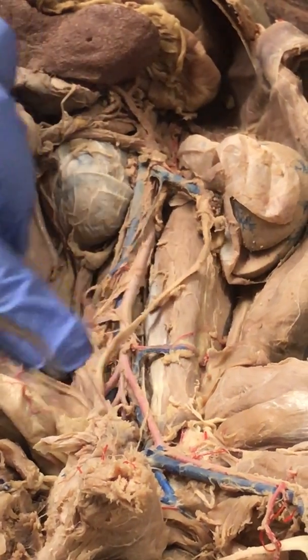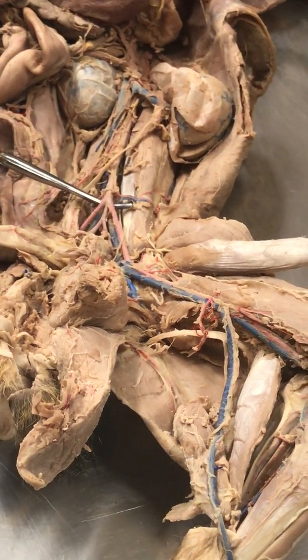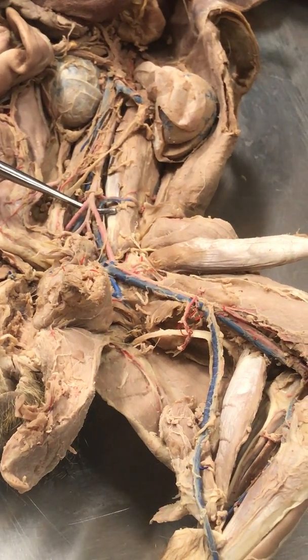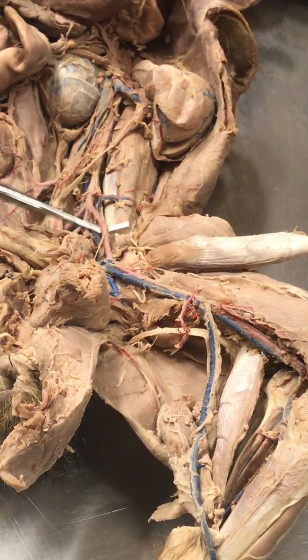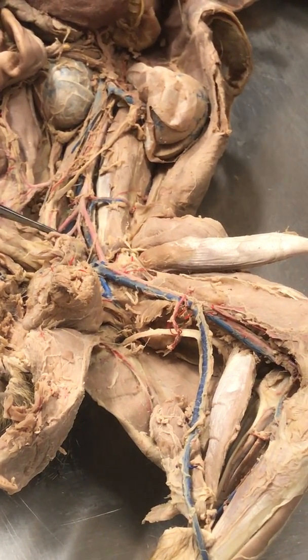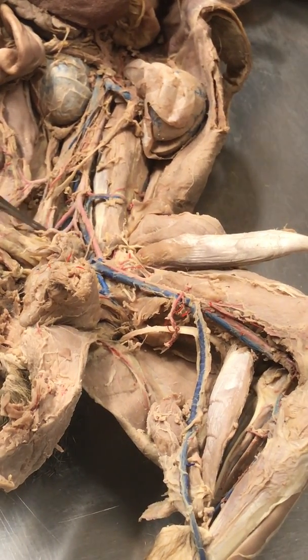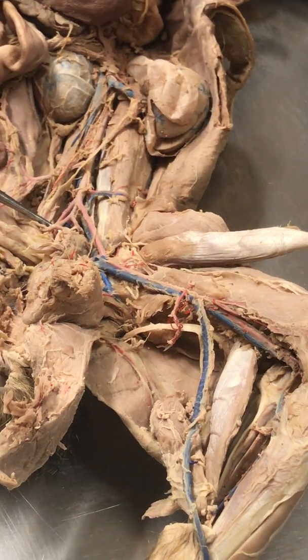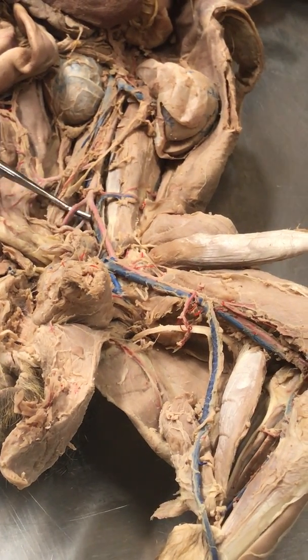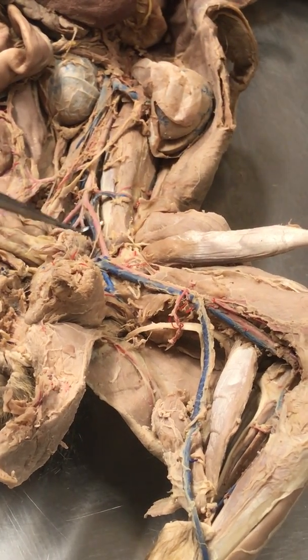Now, if we follow this, if we go downwards, you get to see that at some point the aorta will bifurcate. It'll stop, right? It'll split. Cats do not have a common iliac artery, which means that this vessel is not the left common iliac artery. This is the left external iliac artery. This little one is the left internal iliac artery, and this other little one, the right internal iliac, and this is the right external iliac. This here is the right external iliac vein.